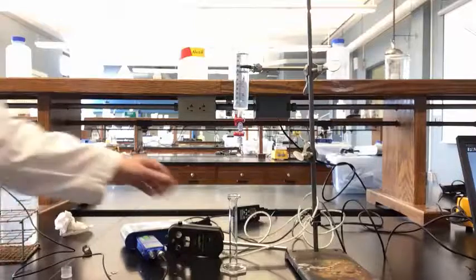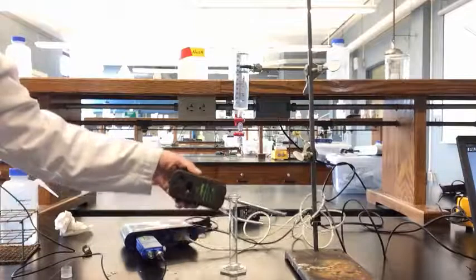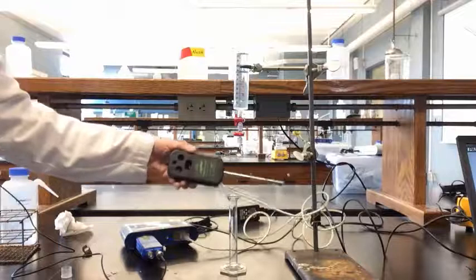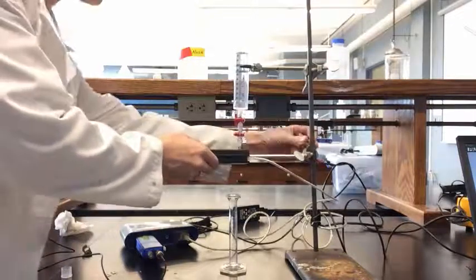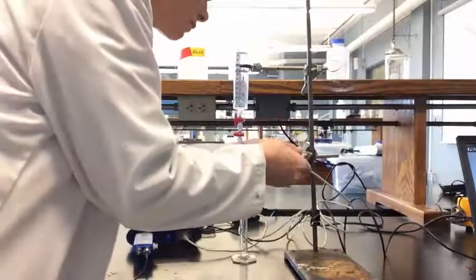This video will demonstrate how to calibrate the drop counter. First use the clamp to secure the drop counter to the ring stand and position the drop counter just above a 10 milliliter graduated cylinder.